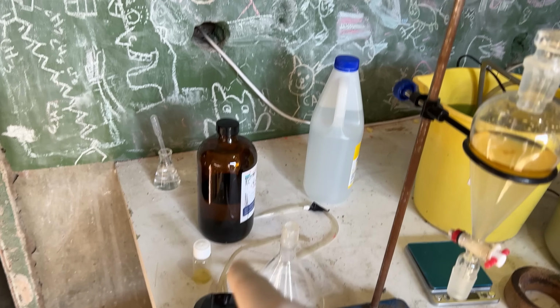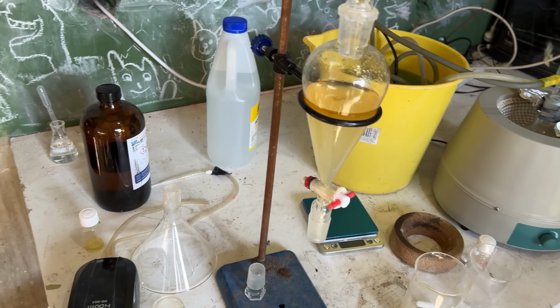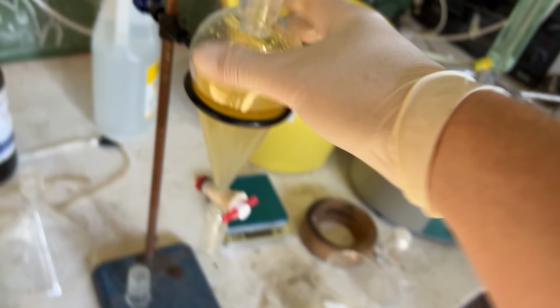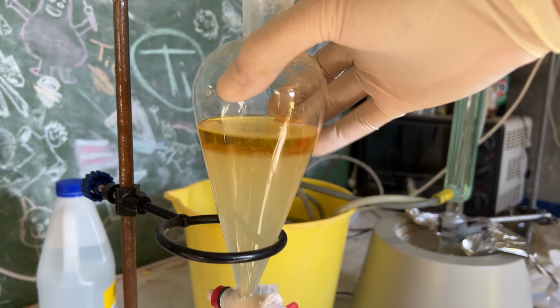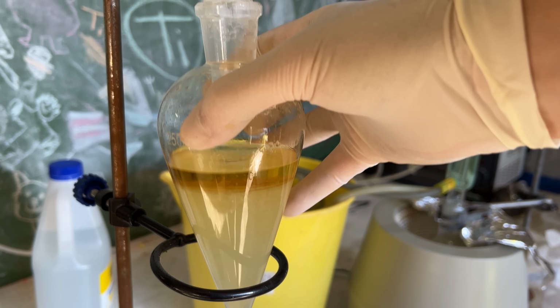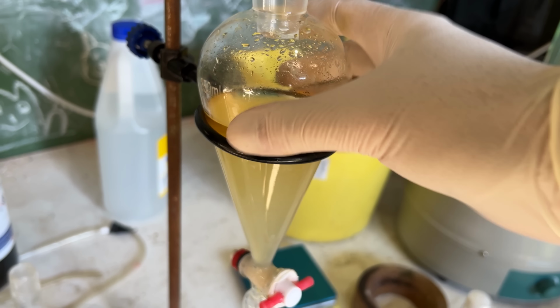Okay, I wasn't getting too far with the dichloromethane extracts, even after saturating with salt. But on a whim, I thought I'd try ethyl acetate instead. And look, all the colour's actually gone into the layer. But with the dichloromethane, it was so clear it wasn't taking much of the colour, which I assume the organic product is causing. So, okay, maybe dichloromethane's just a terrible solvent for this.